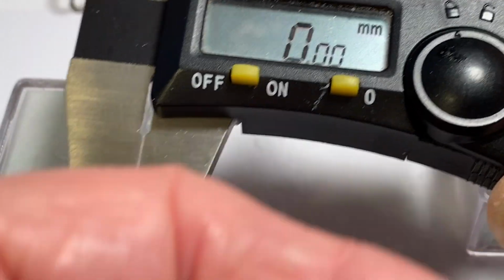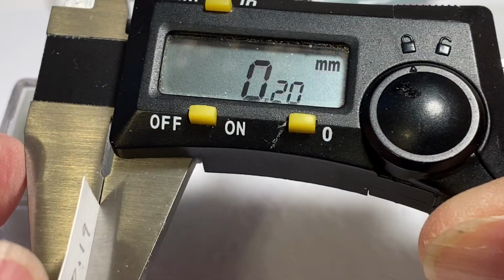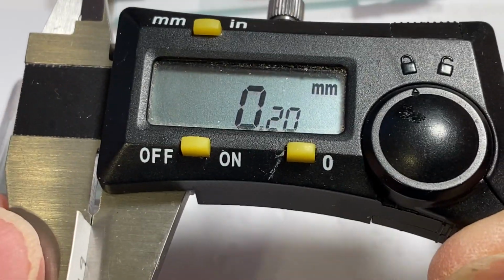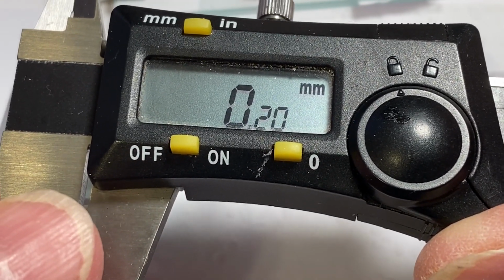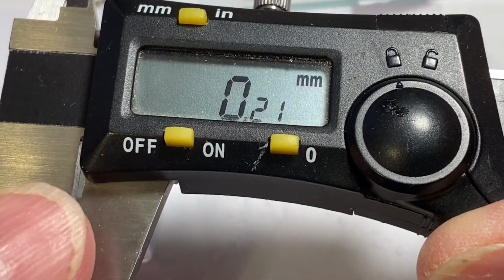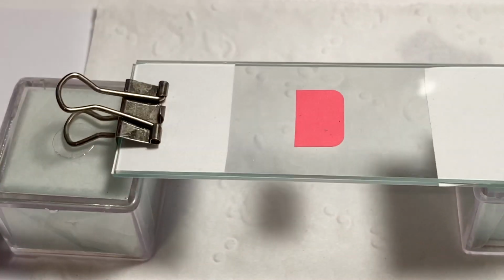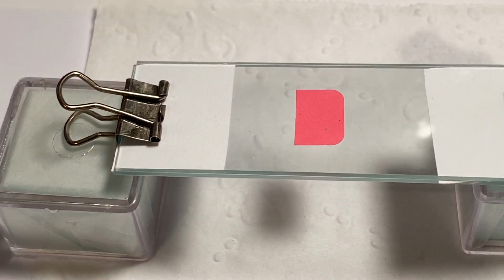Here's the paper shim right here. I measured it, about 0.2, some come in at 0.1. But anyway, it was a 3.5 by 5 index card. Some index cards are thicker than others, but you can cut them into little squares. If you want it thicker, you stack them. If you wanted it thinner, you can use aluminum foil. But for my purposes in this video, the 0.2 is good enough. So let's pretend the pink thing is an insect.